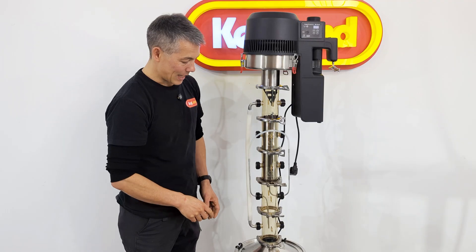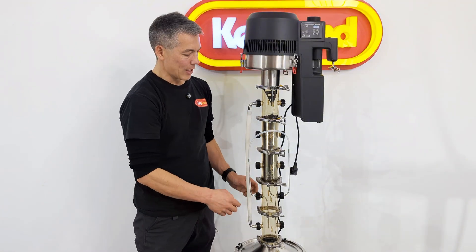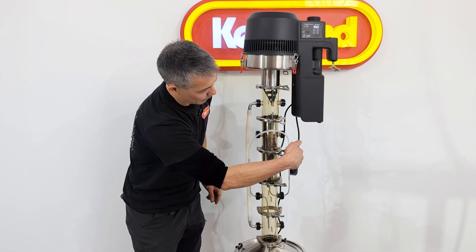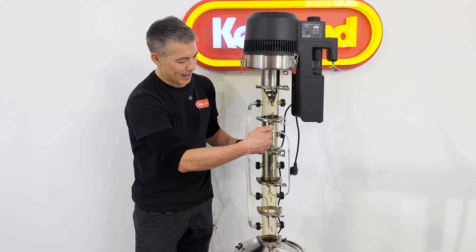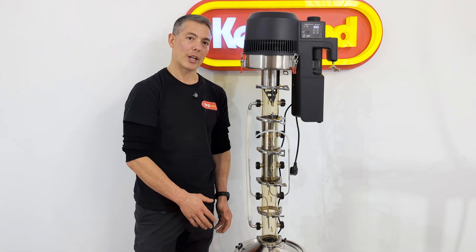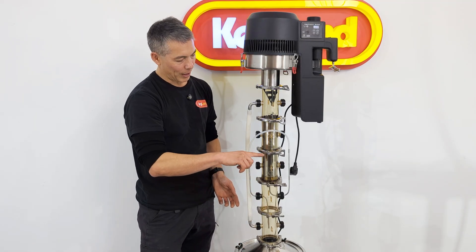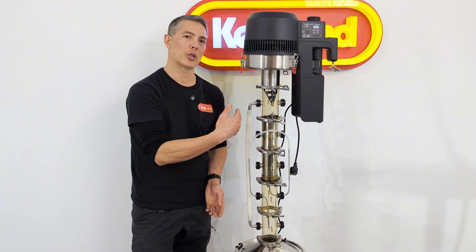I've manufactured a stainless steel blanking plate which also has a tube on the underside. This gradually fills up — it's connected with a tube on the underside. The liquid fills up in this arm and eventually fills up inside this tube. Once it gets to the top of this tube it will start siphoning back down, goes down the tube, and exits back down to the boiler. It's a bit like a bell siphon — the steam comes up, hits the condenser, gradually fills this chamber, and then starts the siphon, which empties the chamber, and that process continues over and over again.